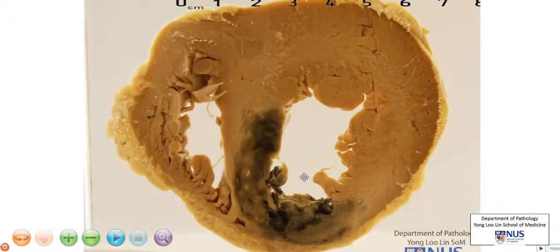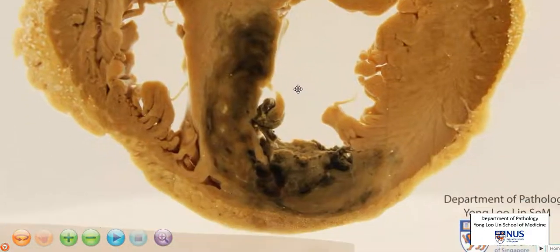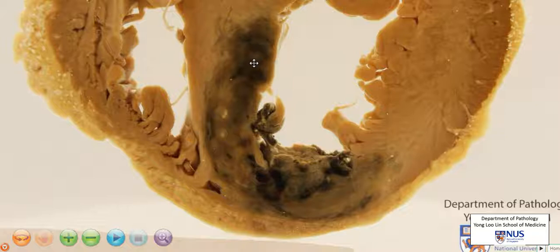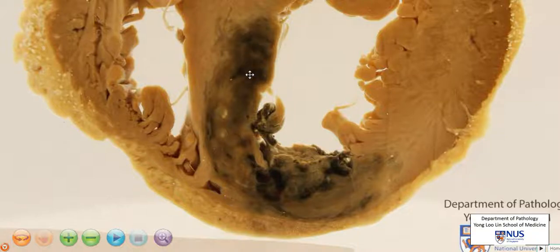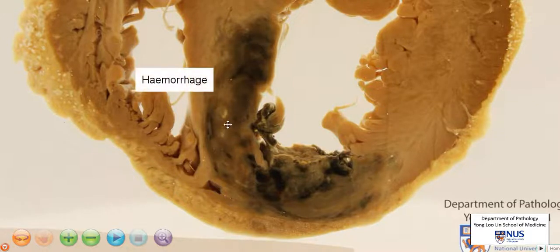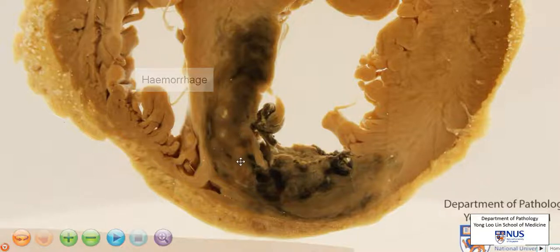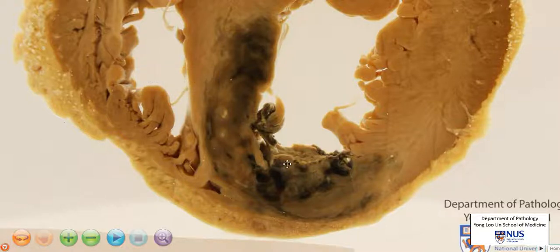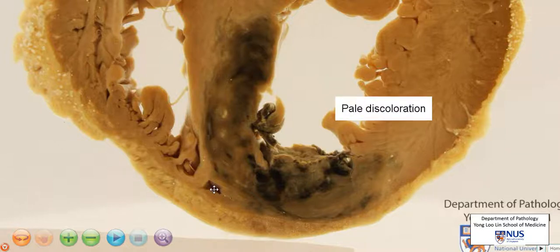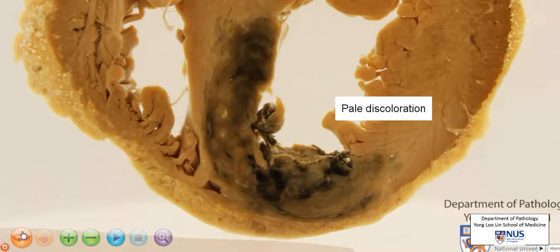Let's zoom in a little bit closer. We can see that there is an area of darkish, almost blackish discoloration. This represents hemorrhage, and this is admixed with an area that is a little bit subtler here. This is an area of pale discoloration and this is probably better seen on the opposite surface.